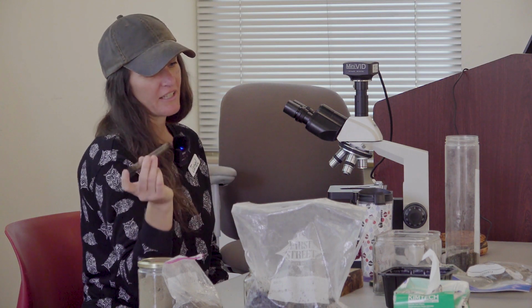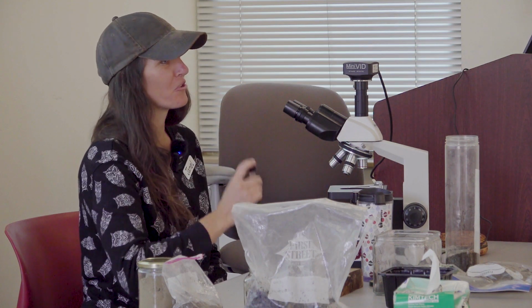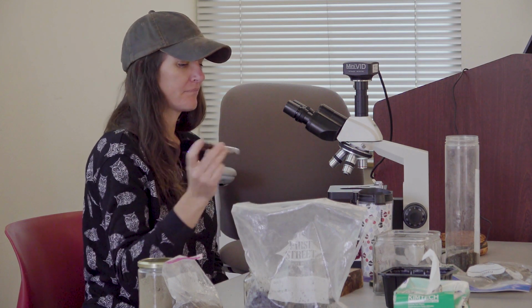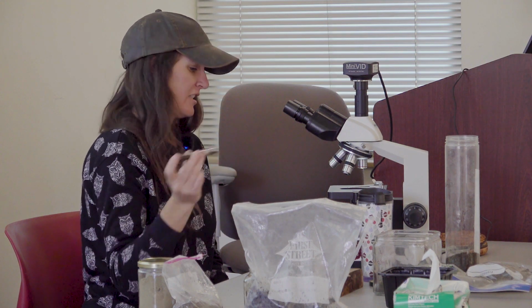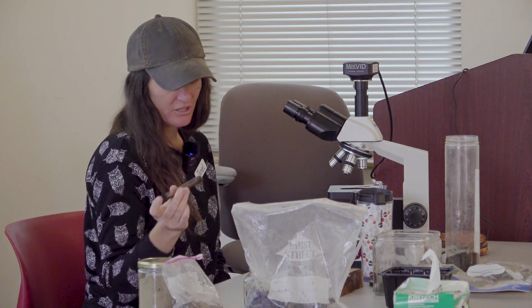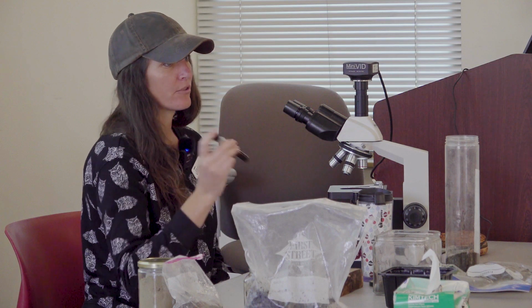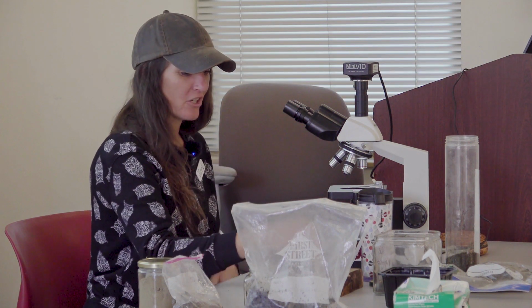And we shake it up like this because we have to knock the microbes ideally off of the particles of material and the soil and get them out into the water so we can observe them a little bit better. Because it's hard to get chunky stuff underneath the cover slip. If you do come up here to hang out and look at your own sample, I will caution you, cover slips for microscope slides are these impossibly thin slices of glass. They disappear and end up in your foot very easily. So, you know, all the fun cautionary tales.